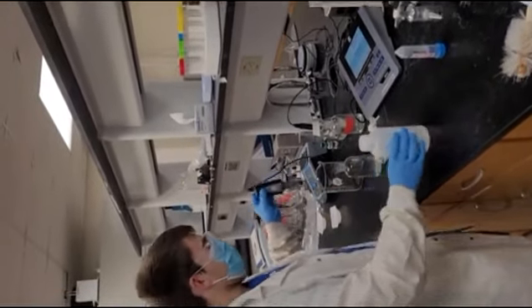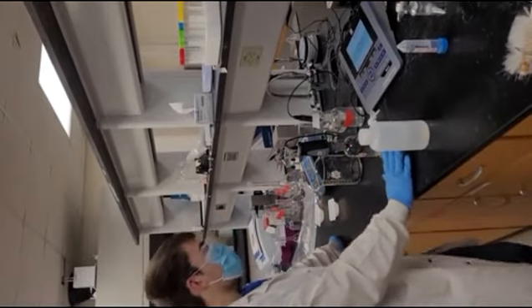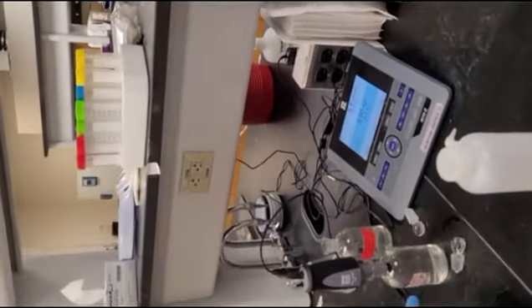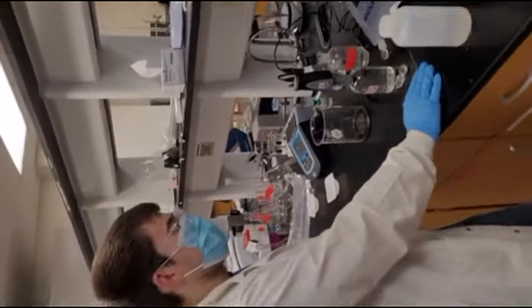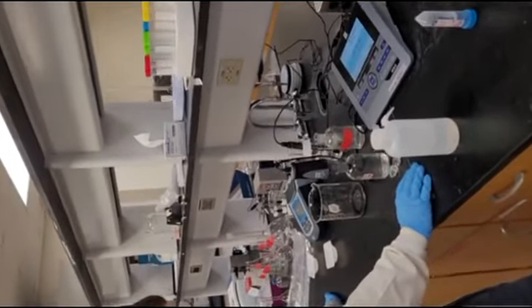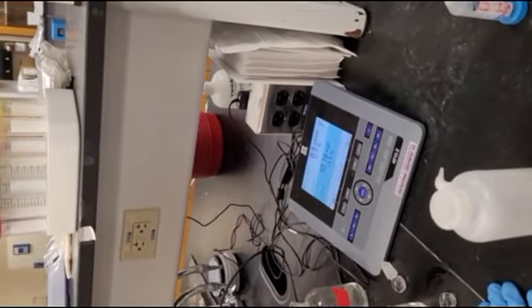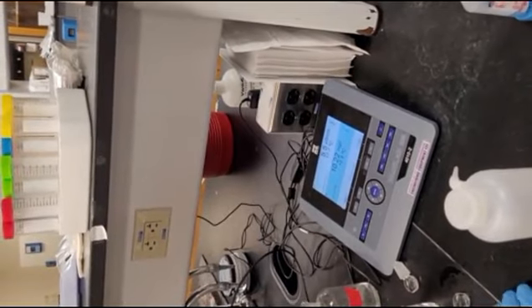And a couple things to note. For the purposes of the demonstration for this video, we're just doing one of each, but you should do it in triplicate, and those coming to the lab will be doing theirs in triplicate as well.